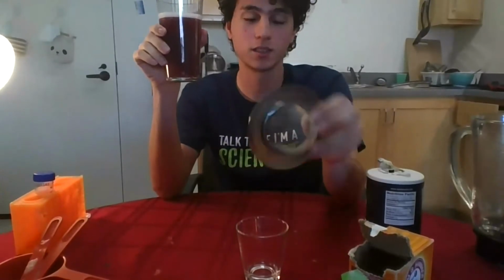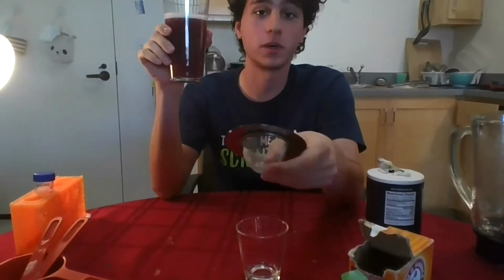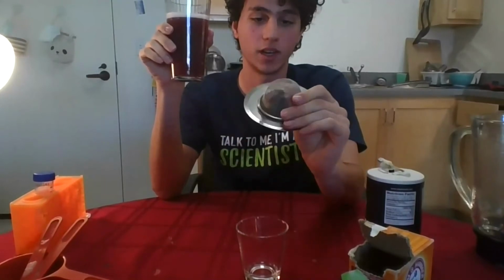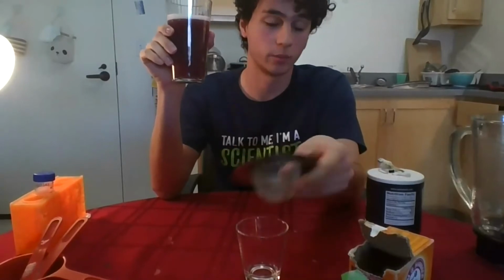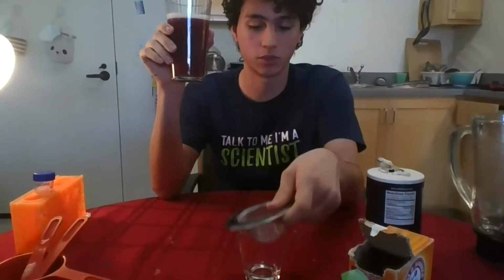And what I'm using right now is just a regular strainer that you could find in the kitchen sink. I think this is fine enough so that I don't really need to put some paper, because it will be able to do the job without the paper. But if you have a more coarse, a less fine strainer, you can use the coffee filter as Gabriela was talking about. Anything that does the job. Basically, we're trying to get rid of the big chunks of strawberry that are still left from the previous steps.